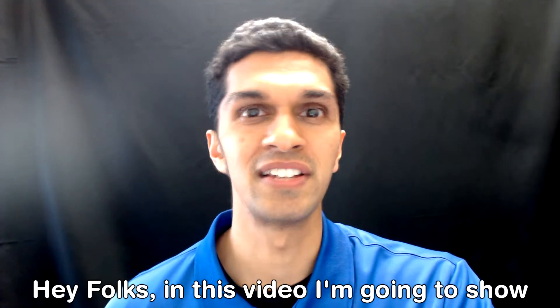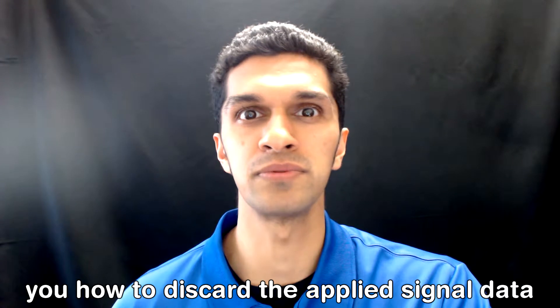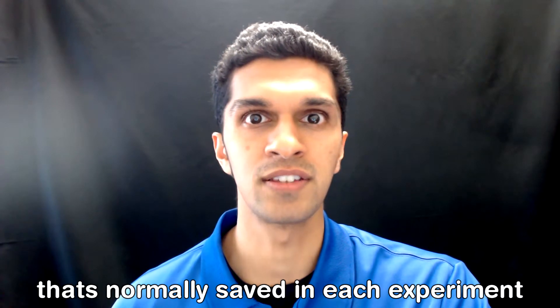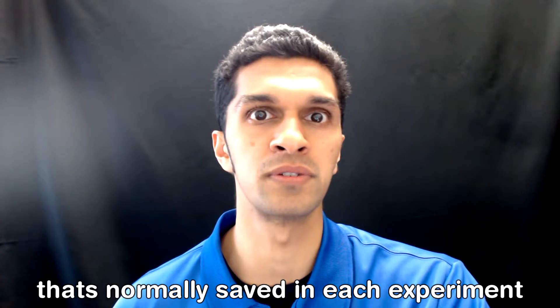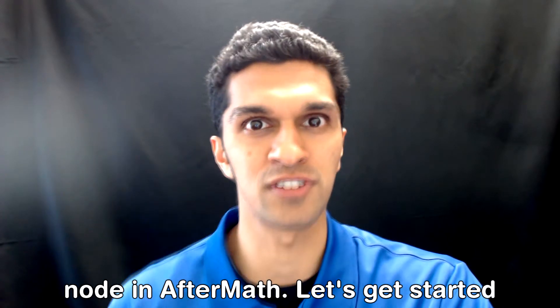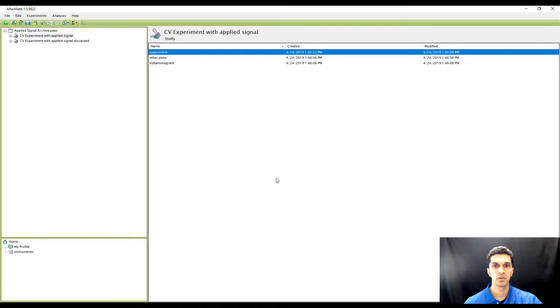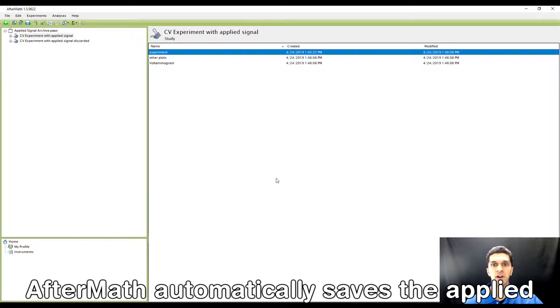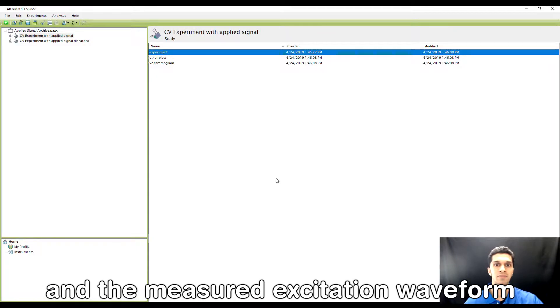In this video I'm going to show you how to discard the applied signal data that's normally saved in each experiment node in Aftermath. Let's get started.